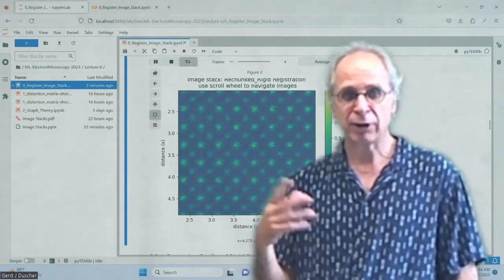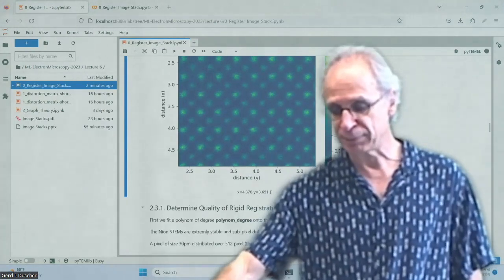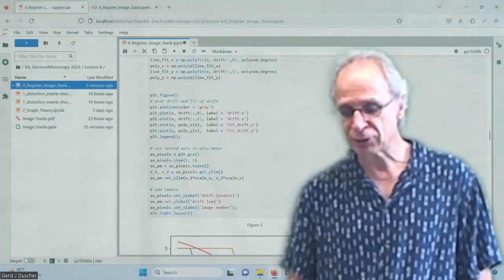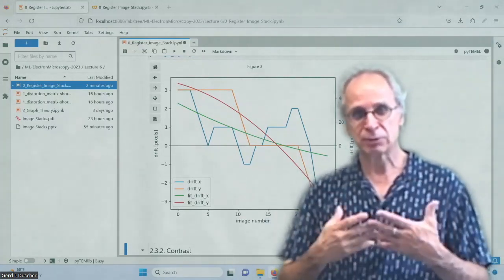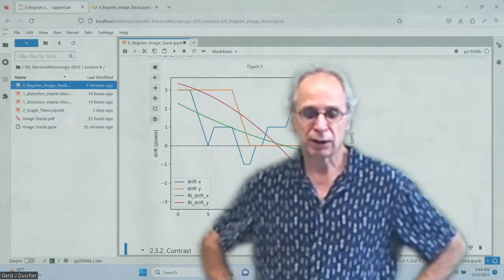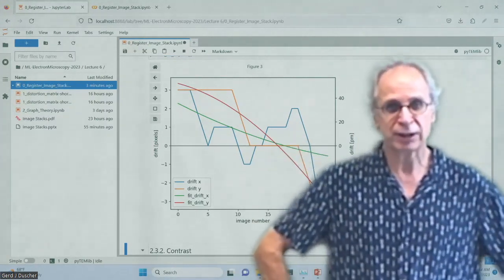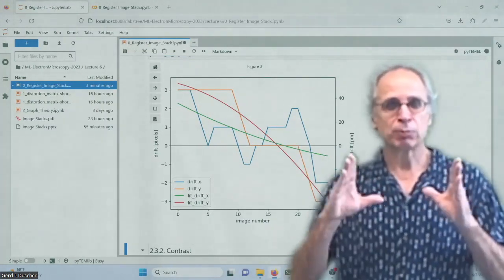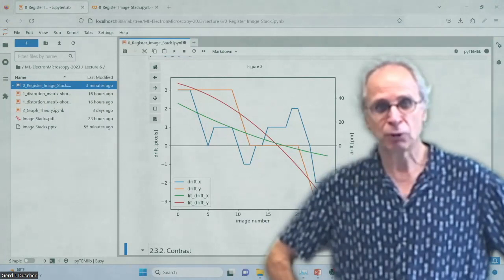So the random ones we can average out. That's why we use a stack. That's another reason to use a stack. So how good was it? Of course we can just look at the drift and determine our accuracy. So is it worthwhile using this image stack? If you have much more than a pixel per frame, depending on how big your frame is, in our case it's 512, then you can think about, should I undistort my image from the rigid registration point of view before I go on? That could be done.